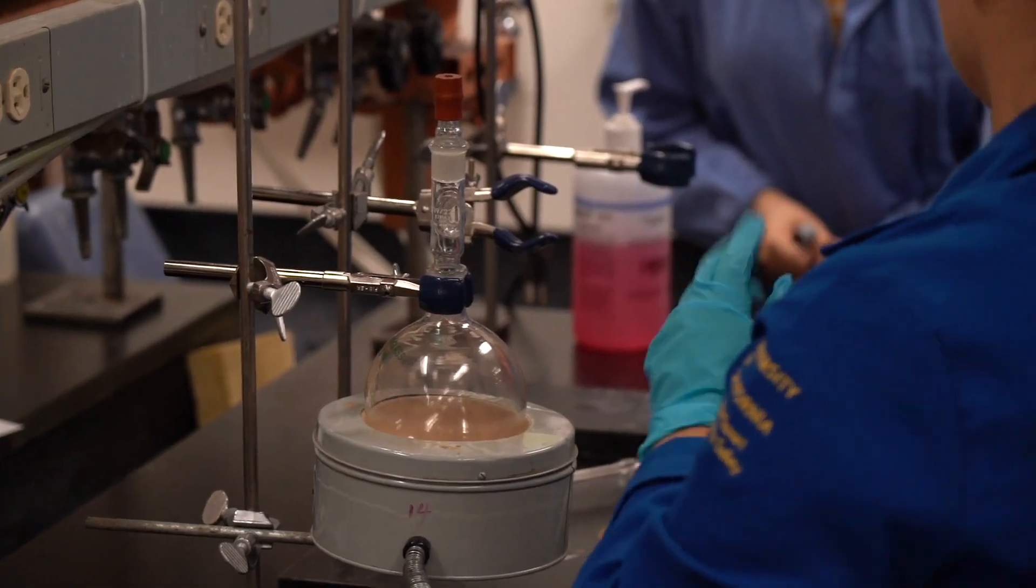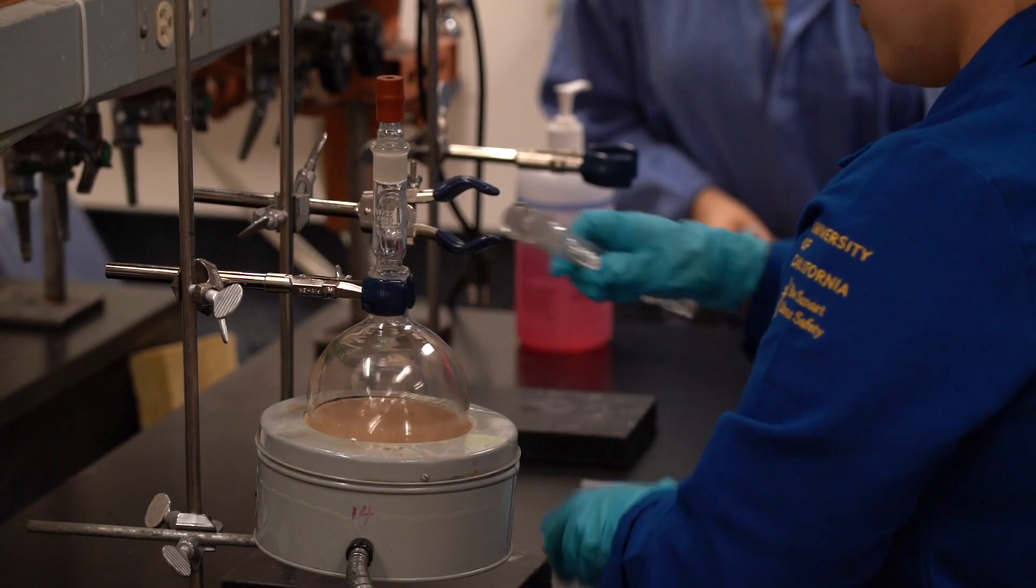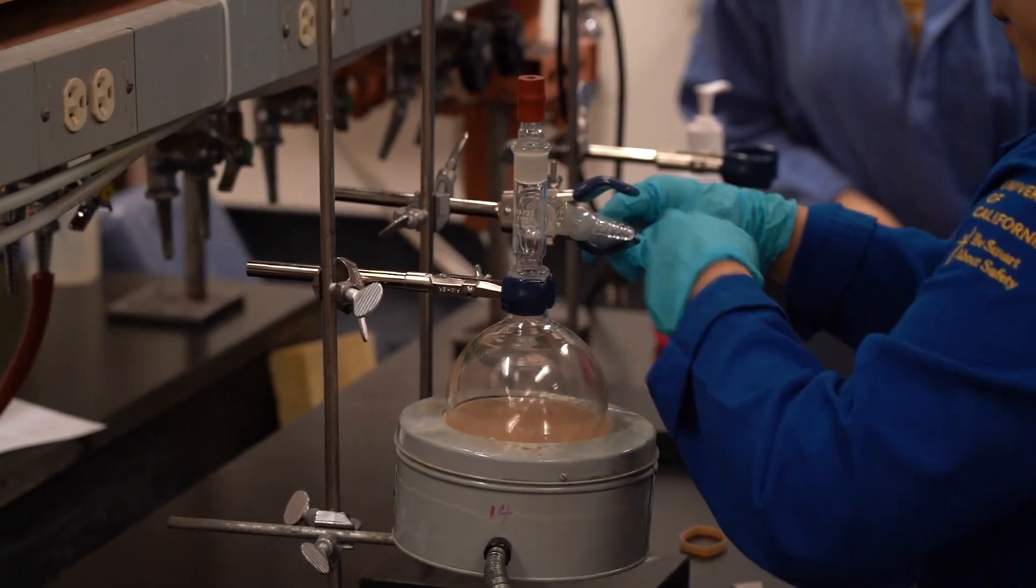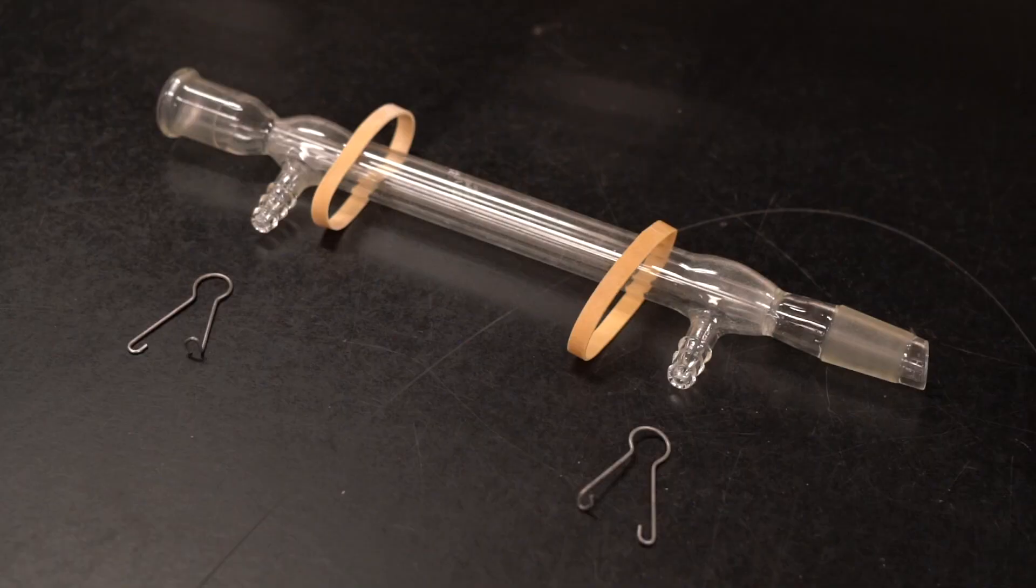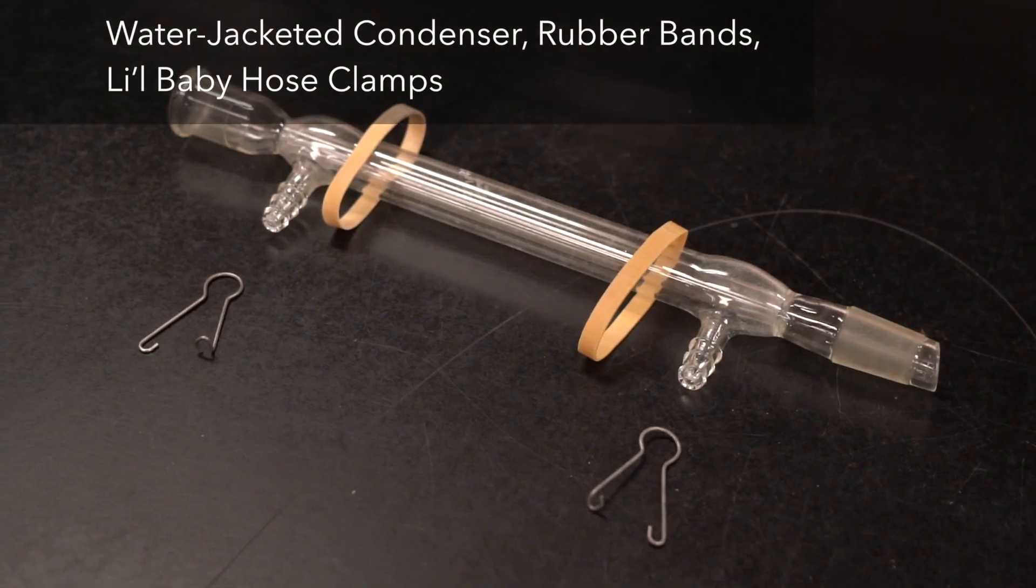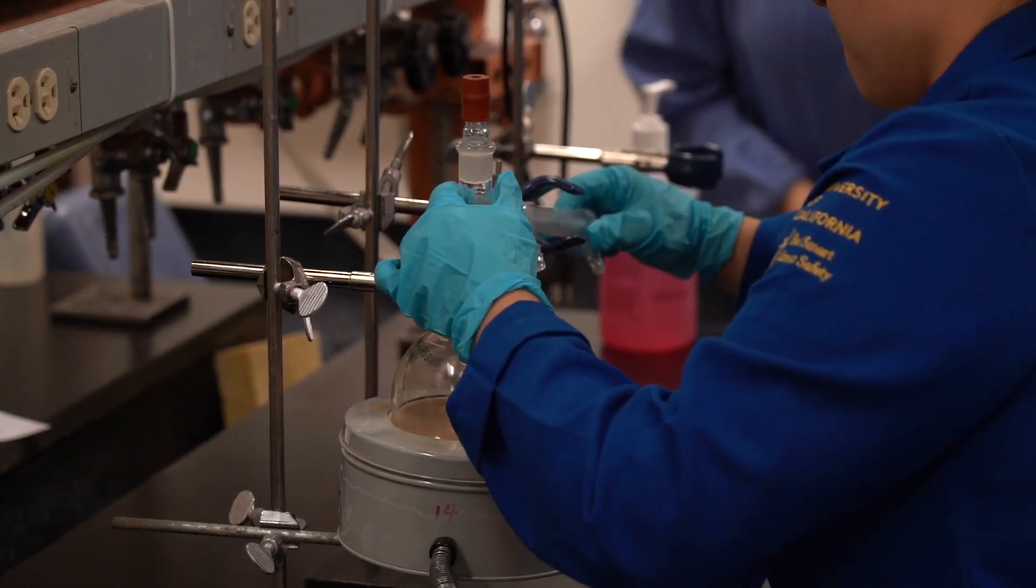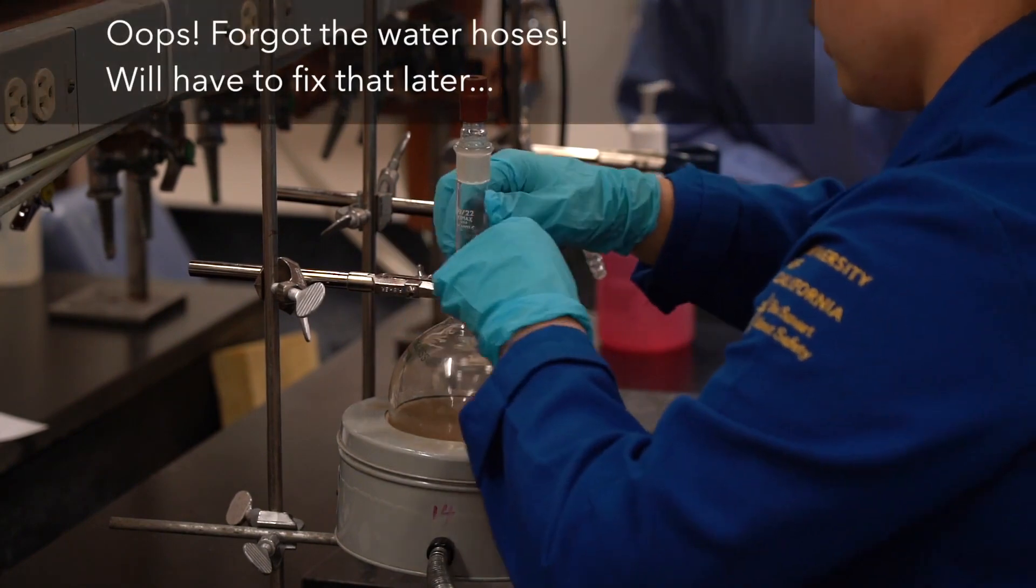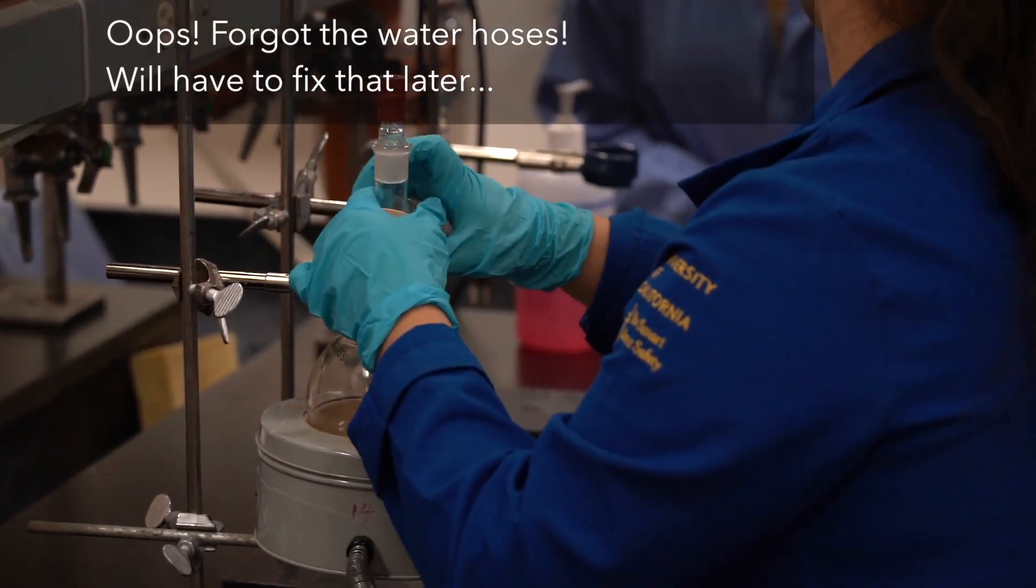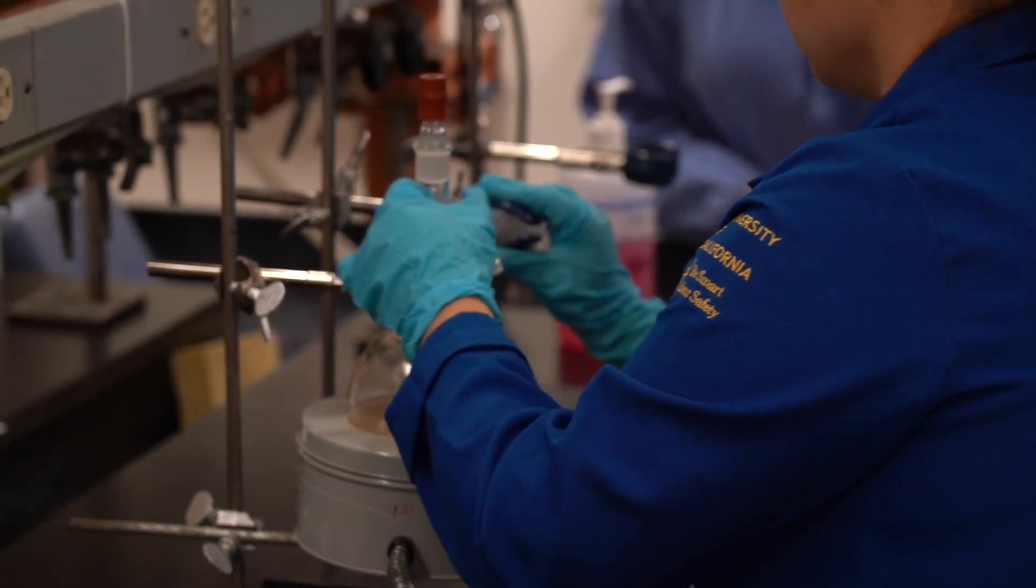Asking any questions along the way. Like that. Then we're going to grease all the glass joints. Attach. So this is just to keep the two apparatus, the two glass joints together. Loosely clamp.